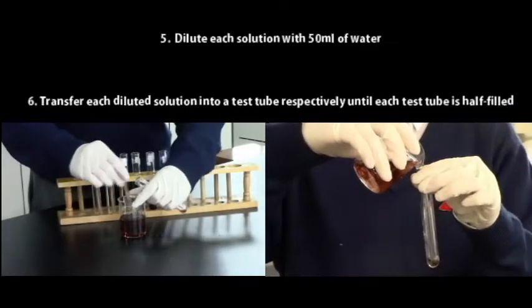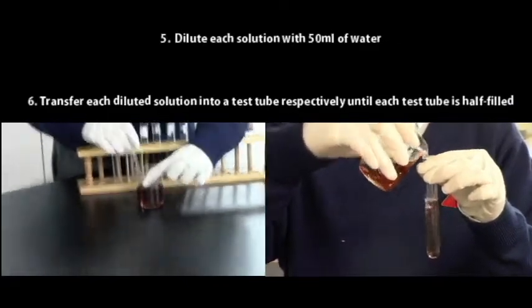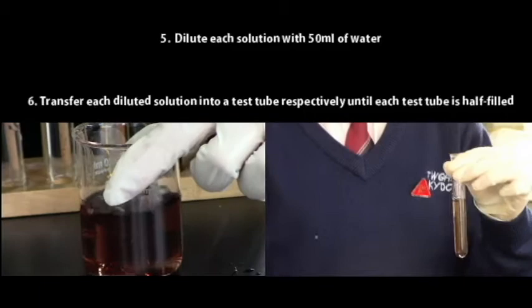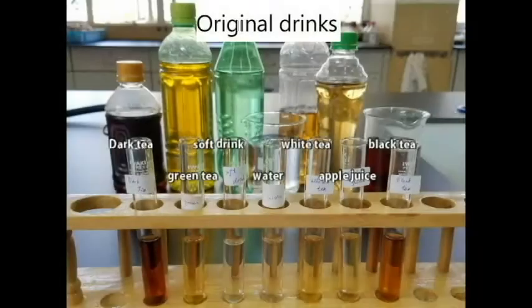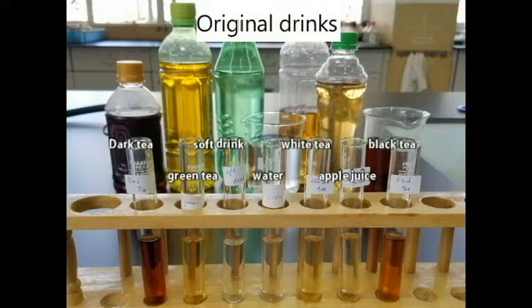Dilute each solution with 50 milliliters of water. Here are the photos of the 7 solutions after each procedure.